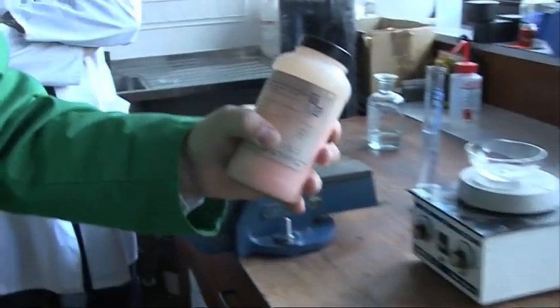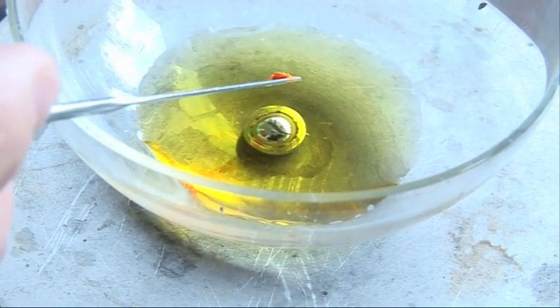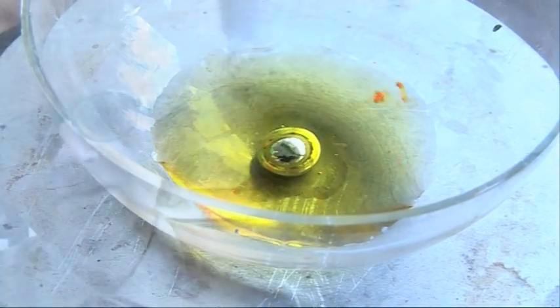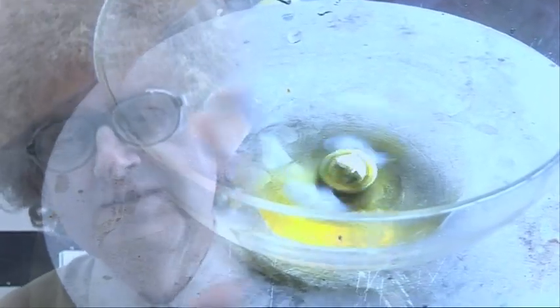So what we're going to do is we're going to use dichromate. Dichromate's a fantastic oxidant, and we're going to put a small amount of it in and see what happens. So gallium, I realize now, is named after France. It was discovered by a Frenchman, and its name comes from the old name for France, Gaul.